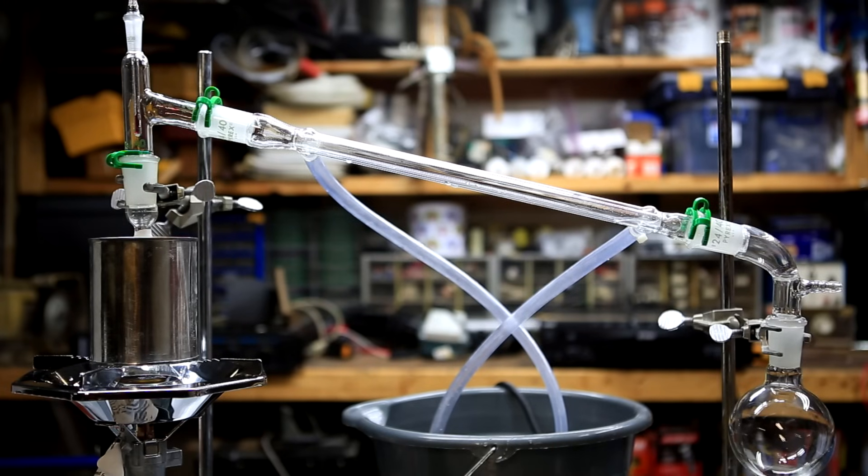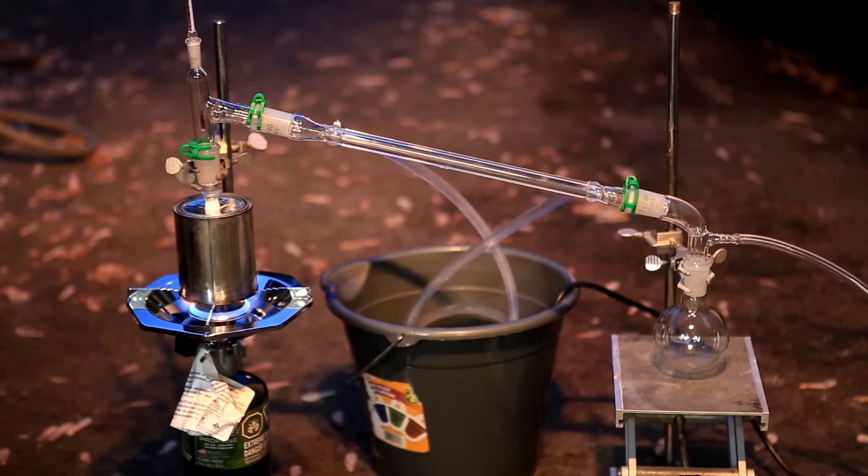Then a simple distillation was set up where a camping stove is used as the heat source. For obvious safety reasons the setup was moved outside. The propane heater was turned on medium and this began the distillation.